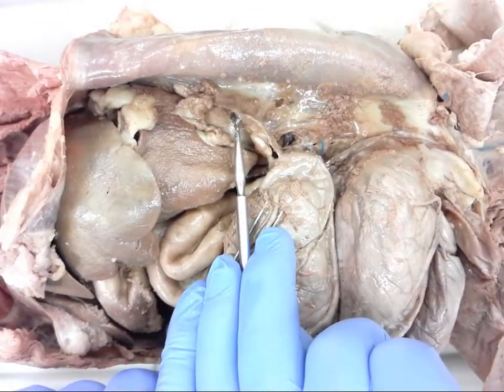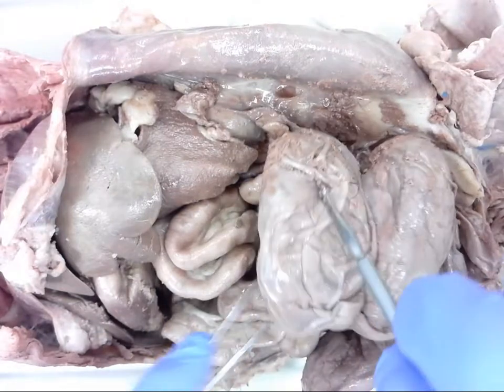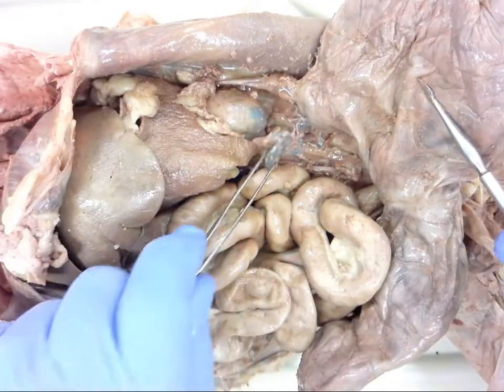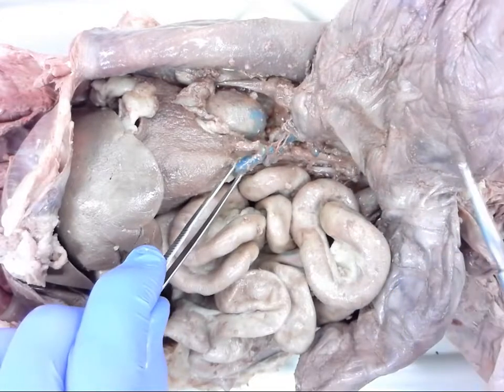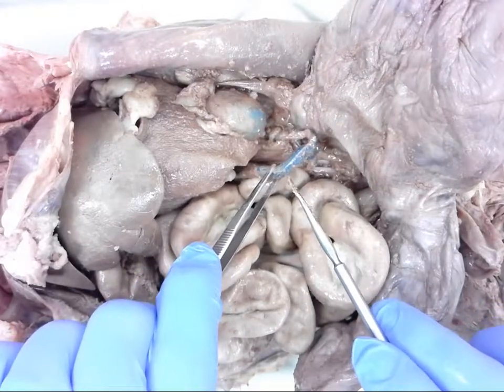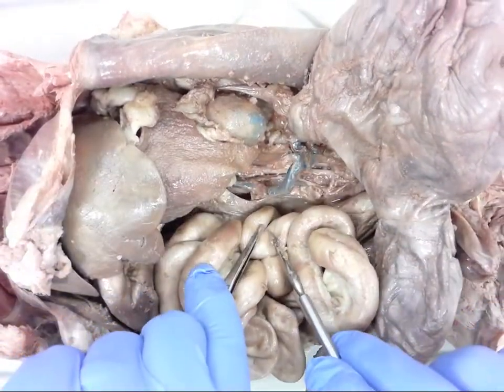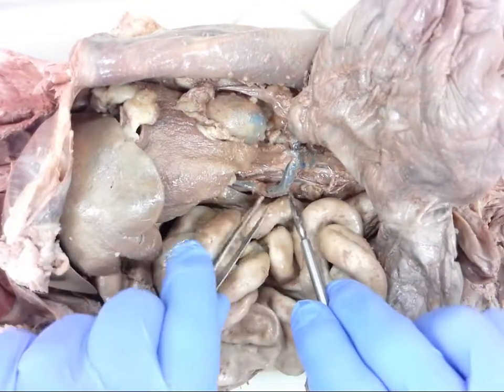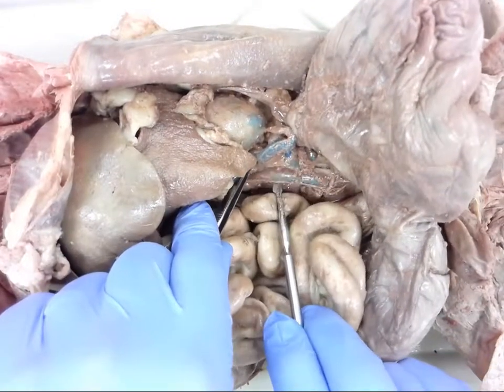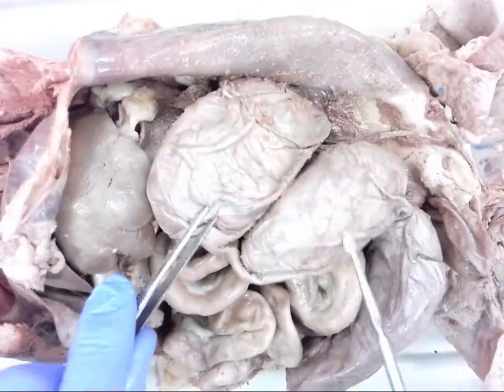The uterine horn comes up here, kind of twists around, and it goes wherever it can find space - it's going to develop based on available space. Deep in here is the end of it, and here is your ovary. The ligament is still in place, a little bit stronger to help hold things together; membranes are still there. I want to show you a change in the size of the blood supply - you can see this through the vein - blood flow coming back from the developing fetuses.